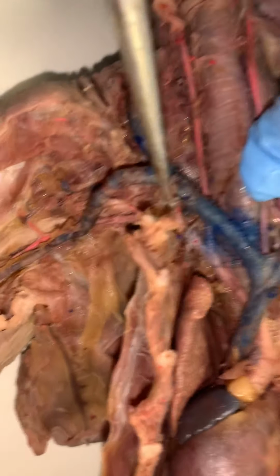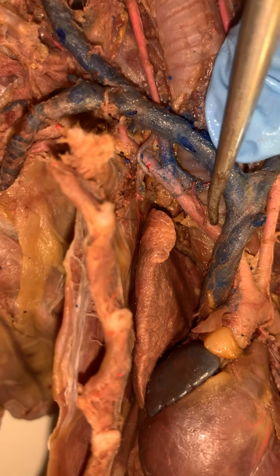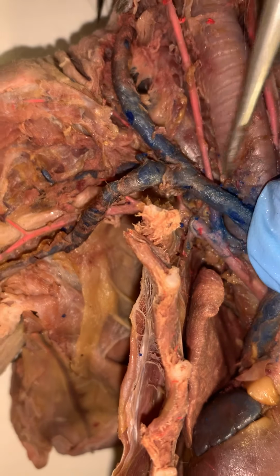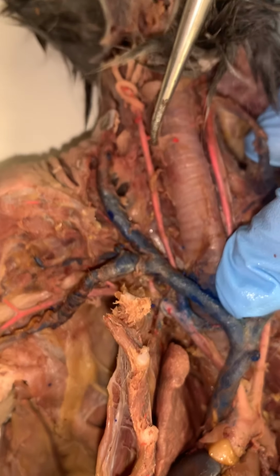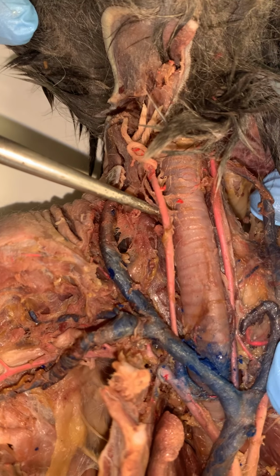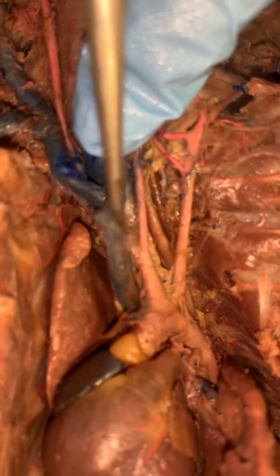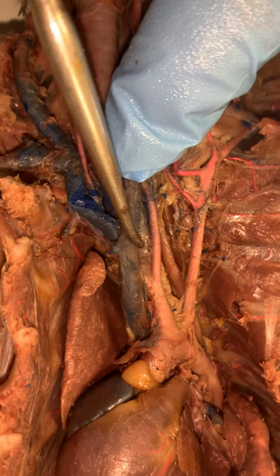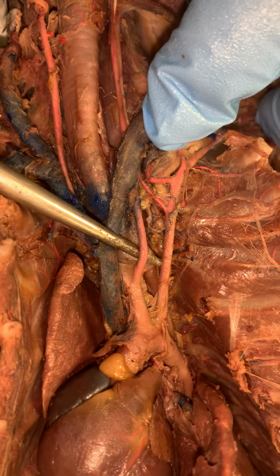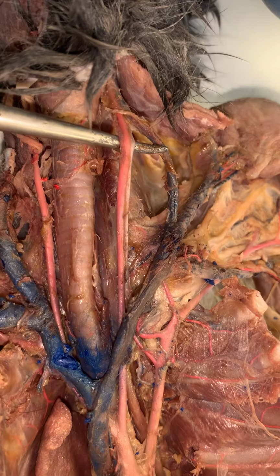But the thing I want you to look at, getting back to this brachiocephalic, you'll notice that the brachiocephalic comes up. I get this one branch going this way to the subclavian, and I get this other branch coming up this way along the trachea. This would be the right common carotid over here. Now, if we go back over, you'll notice this large vessel also coming off the brachiocephalic. This would be the left common carotid that you can see right over here.